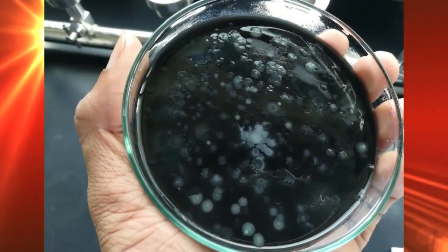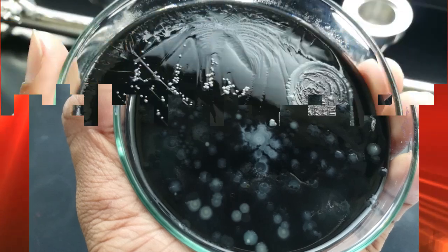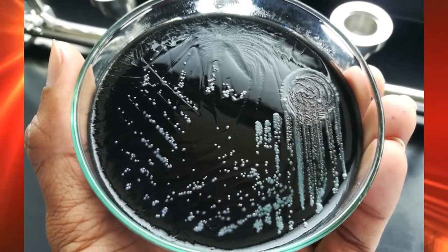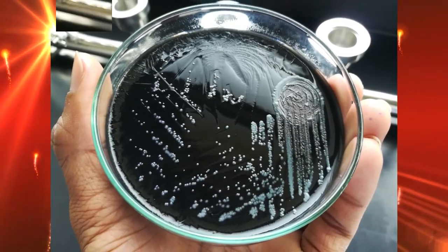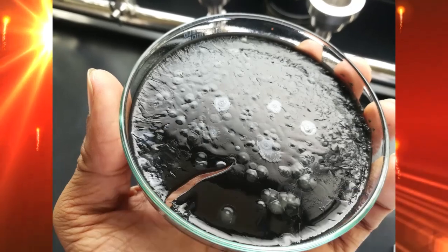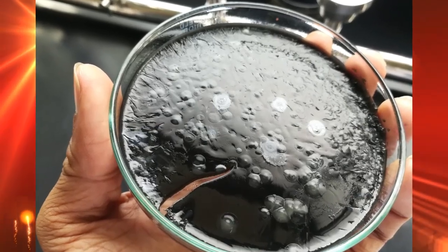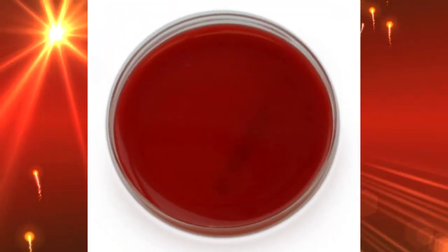Legionella is traditionally detected by culture on buffered charcoal yeast extract agar. Legionella requires the presence of cysteine and iron to grow, so it does not grow on common blood agar media.